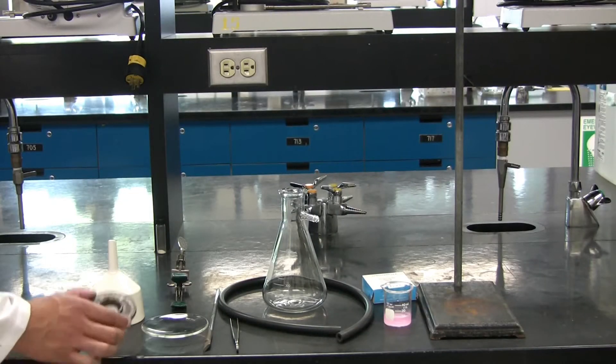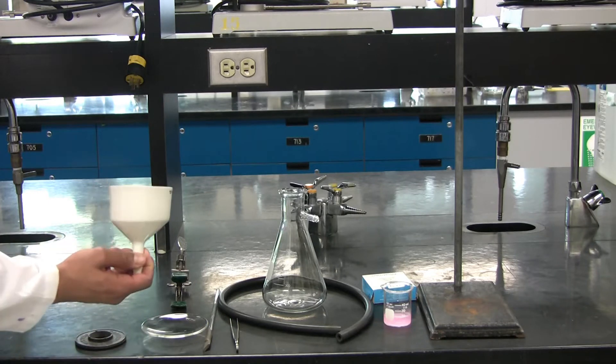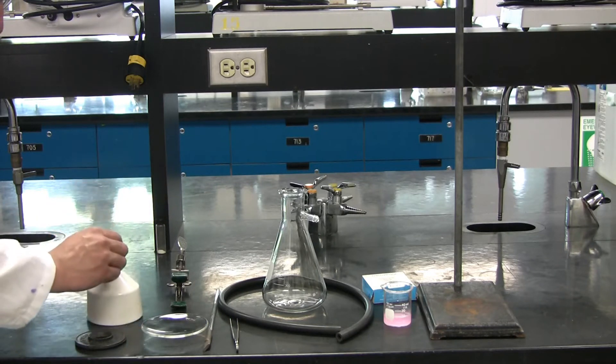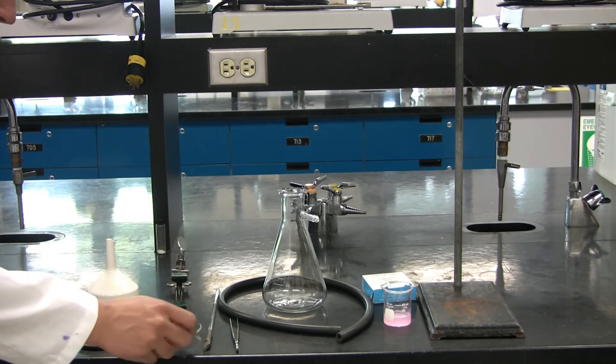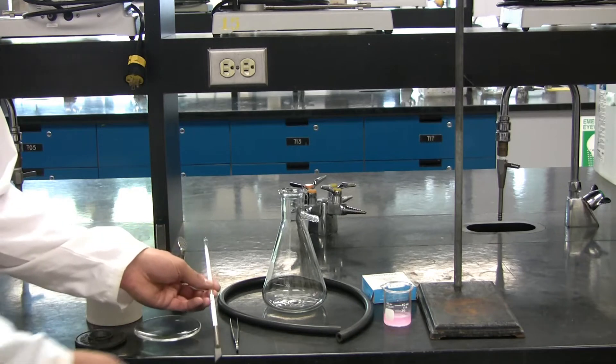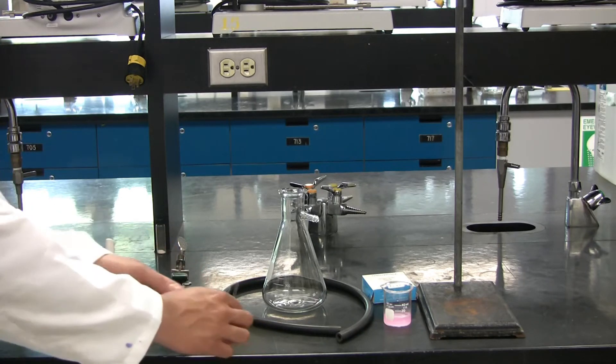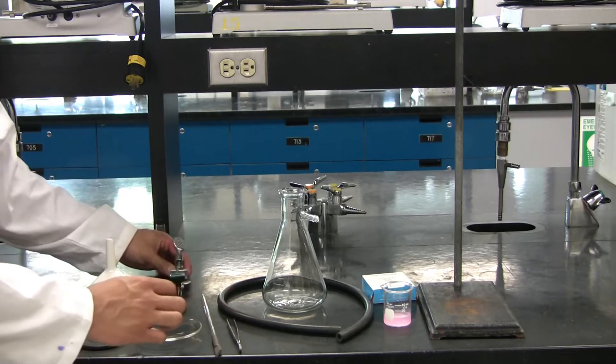You will require a rubber seal, a Buchner funnel, a watch glass, a glass stir rod with a rubber policeman, a set of tweezers, and a clamp.